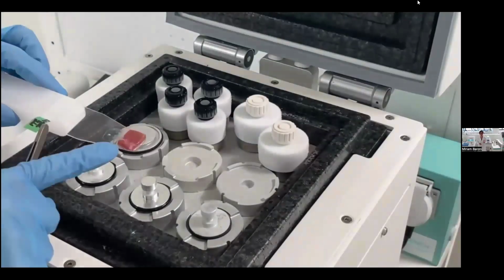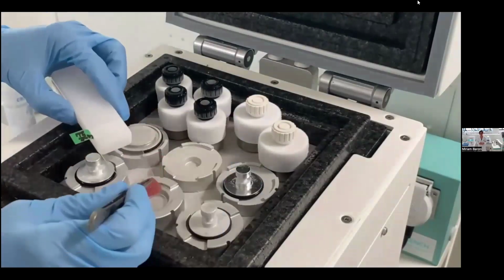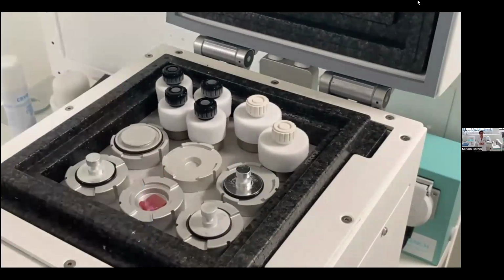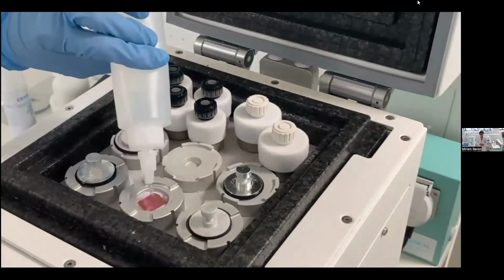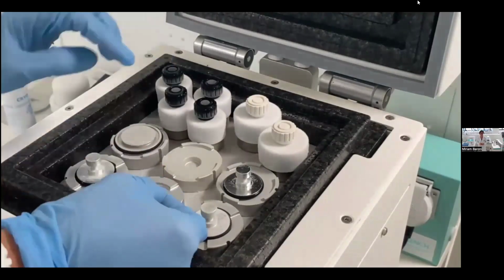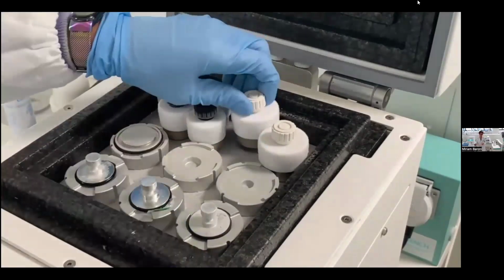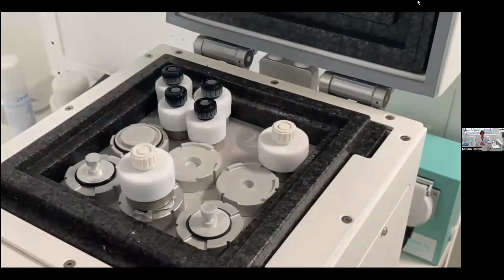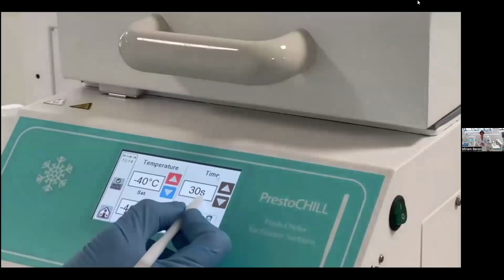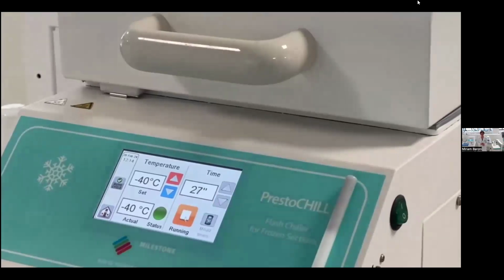In the previous video, I prepared the sample on this spatula. Now I use the spatula to move the sample in the center of the mold. At this point, I can fill the mold with the medium, and if I want, I can add an identification tag to the block. I put the chuck that comes from the cryostat, and an extractor that enhances and speeds up the freezing of the block. Only 30 seconds are enough to completely freeze the sample.